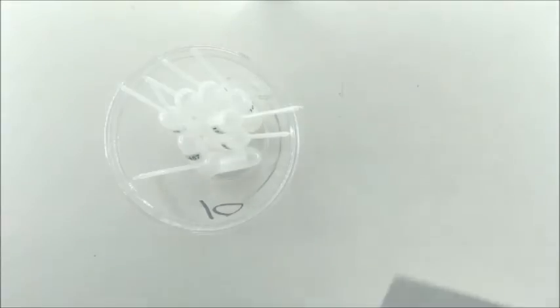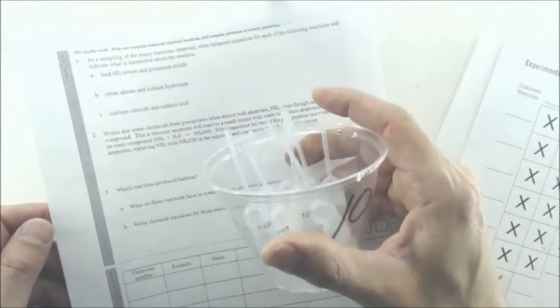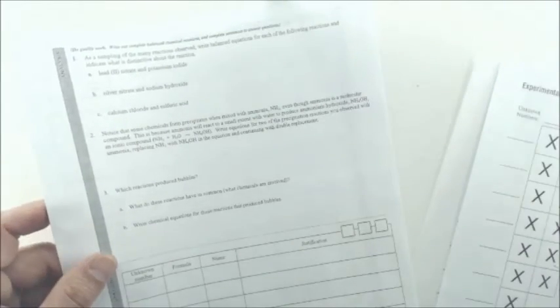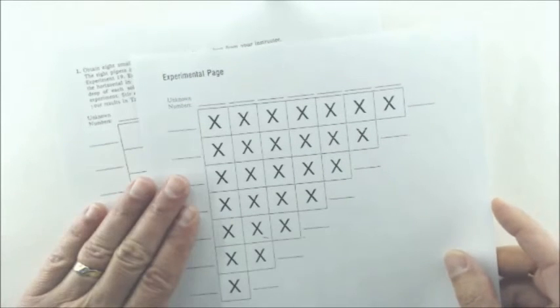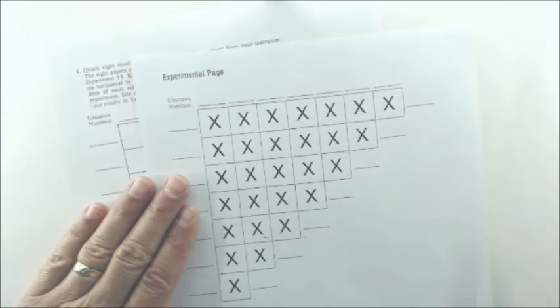On the back of your lab report, down here at the bottom, you've got the unknown numbers. You'll be writing your unknown numbers down here and some formulas in just a little bit. So that's one place you want to put these pipette numbers. They don't have to be in numerical order or anything like that. You just need to have not 10 of them, there's 8 of them. And then you're going to have 2 grids. One grid you're going to take notes on, and one grid that is going to go inside the page protector that you're going to use.